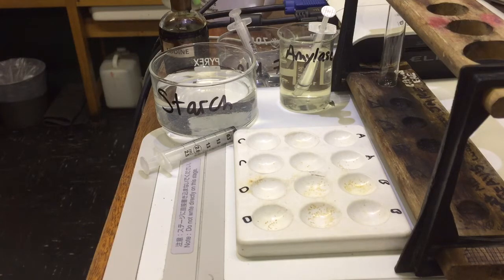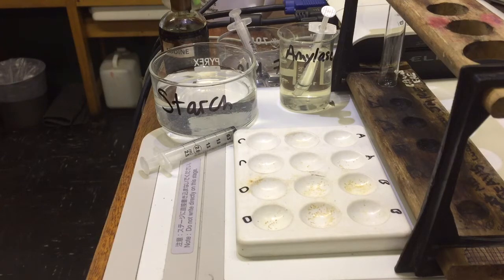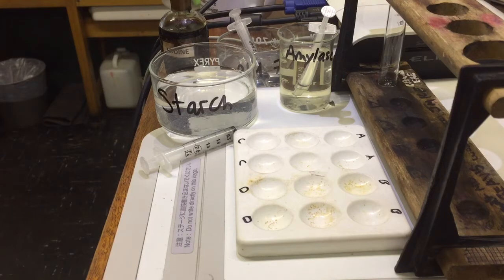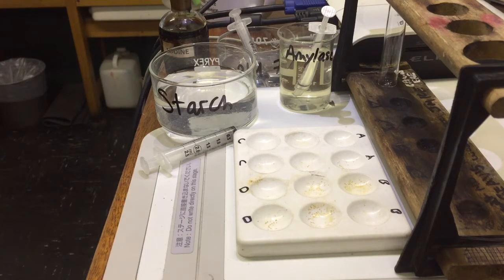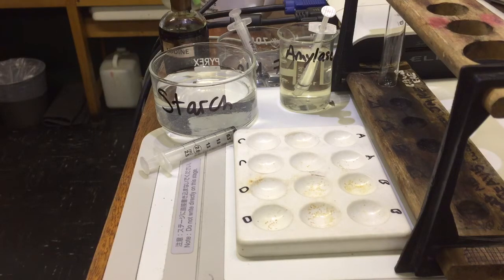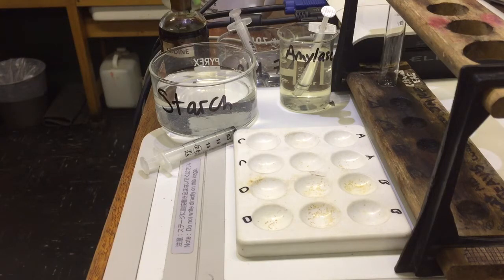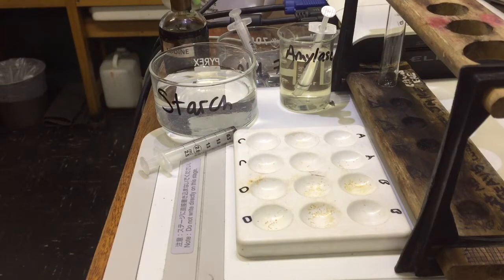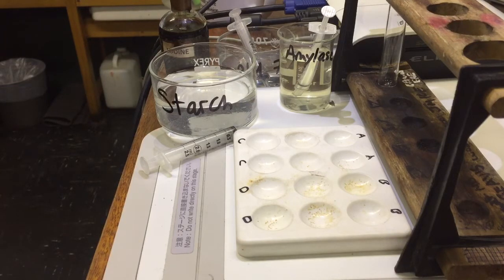Then we've got starch solution. Starch is — what do we call it for amylase? Amylase is an enzyme, but starch is what it breaks down, so we call it the substrate. We've got starch, which is the substrate, and that starch is going to be broken down by the amylase into — glucose. Well done. It's broken down to a simple sugar.